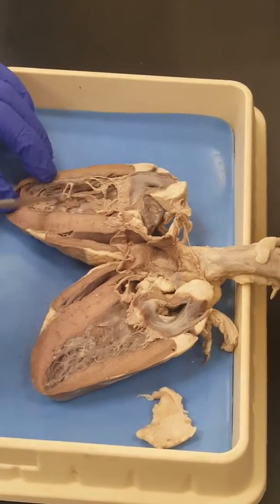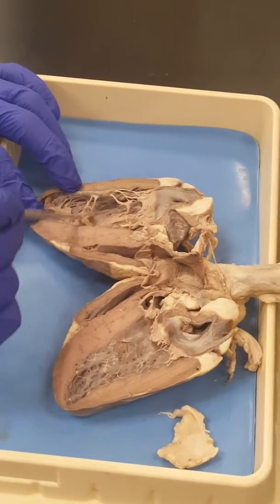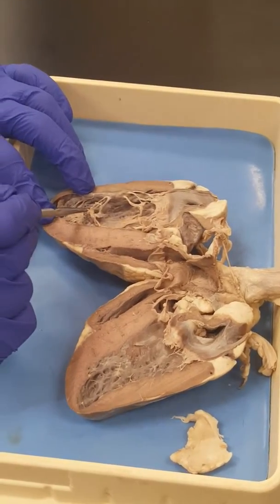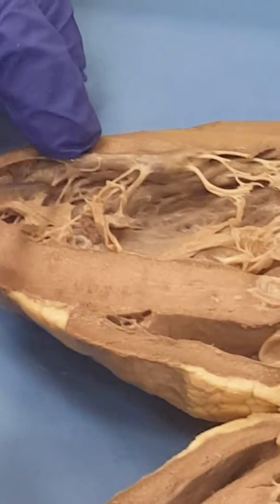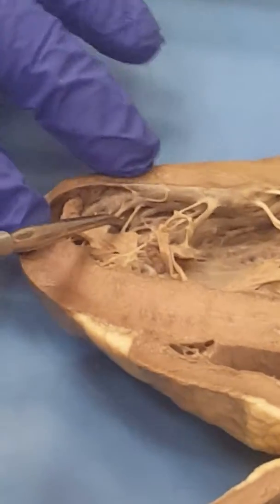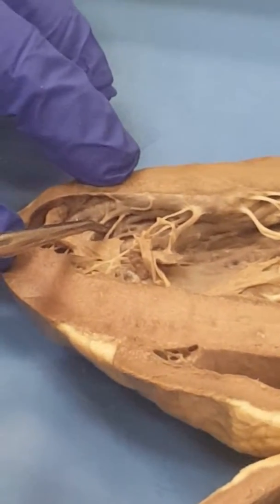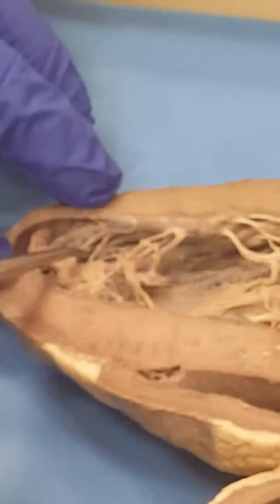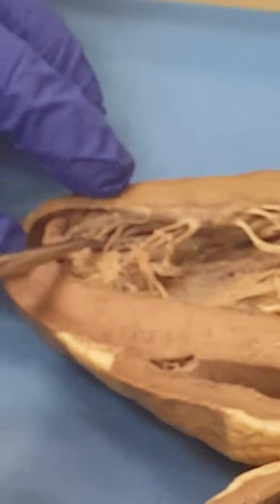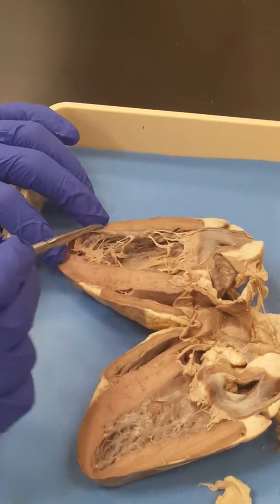One of the things I didn't show you are these ridges, but I drew them in the picture when I drew them on the board. See these ridges right there? These are what are called trabeculae carneae. So if I put a pin over here and I'm talking about what are those ridges in that part of the heart, you don't say left ventricle, right? Because I'm asking about ridges. You say trabeculae carneae. Remember the one I was calling carne asada last time?